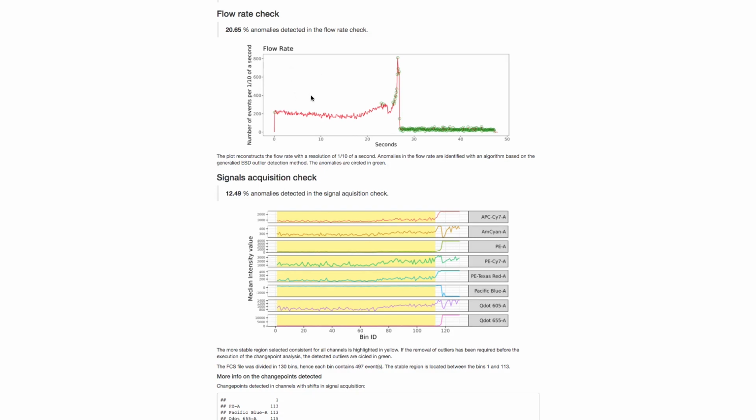So the flow rate check is fairly simple to interpret. It just looks at flow rate as a function of time, and this will also be based on your settings for what your binning resolution is. So 0.1 is the default, which is 1/10 of a second, and any anomalous regions are highlighted in green, and those will be the ones that are identified for rejection. And so you can see here the flow rate drops off significantly, or spikes and then drops off, and most of the anomalies are found and removed from this area.